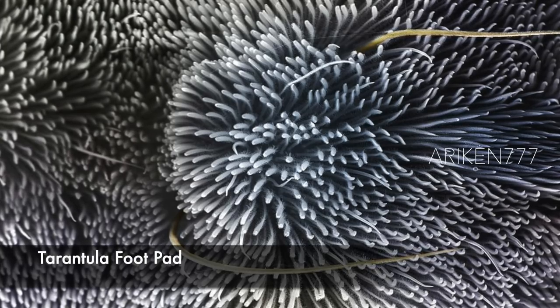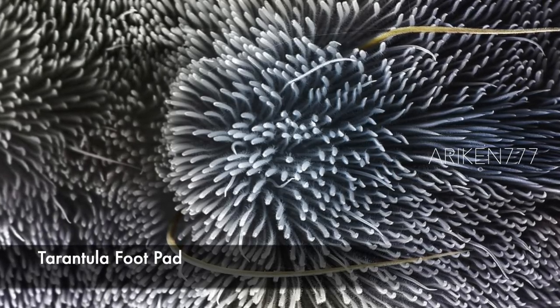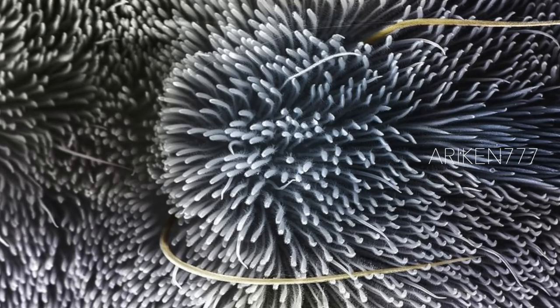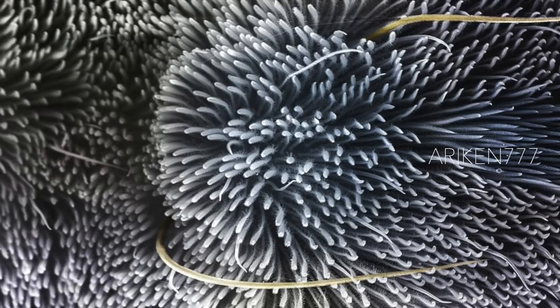Hairs on the foot pad of a tarantula. These tufted hairs have a large surface area, enabling the tarantula to grip smooth surfaces.